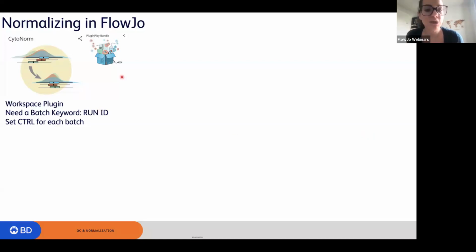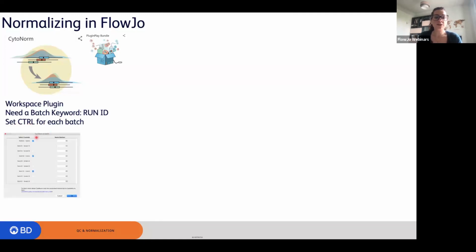Yeah, I will show you this one first, and then I will show you the workspaces. So how you can normalize in FlowJo, there are 3 different ways. One is by using Cytonorm. Cytonorm is a workspace plugin. It comes with the plugin play bundle. You need to add a batch keyword when you run it. That could be, for example, run ID, and you need to have controls for each batch, okay? So when you run it, you will be prompted with a window where you select which are the controls among your files. And then what it gives you in return are normalized files. And I will show you in FlowJo in a second.